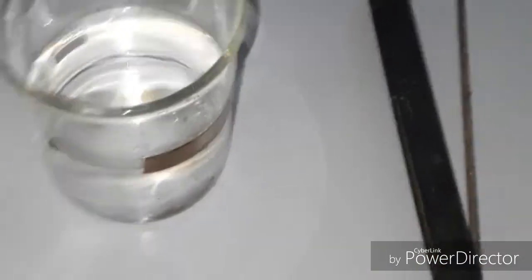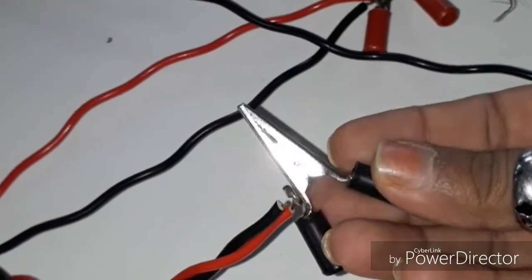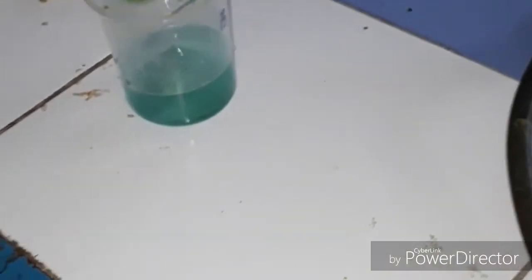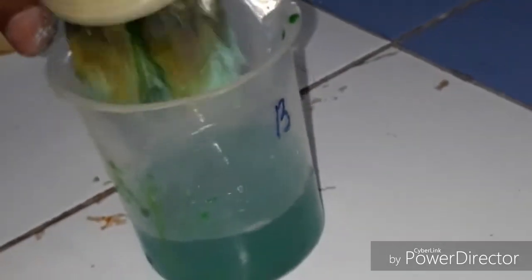Now for this experiment we require copper chloride, which is this way. Electrodes will be used, and we can connect the electrodes to the wires through this particular point. This is the second one. Both are of the same type, and we use water as the medium, and these are the wires with the crocodile clips which we can use sometimes to fix the electrodes. The electrolyte will be first dissolved in water and nicely we'll be mixing it.